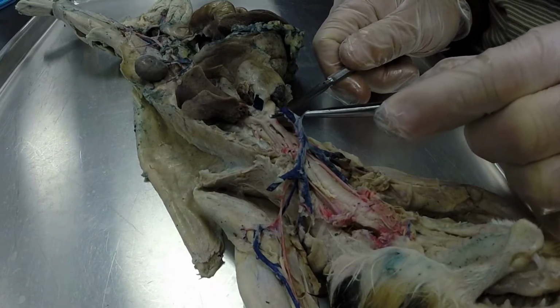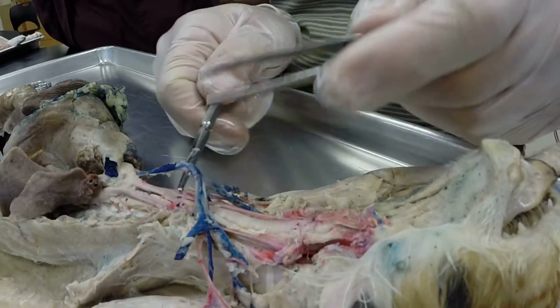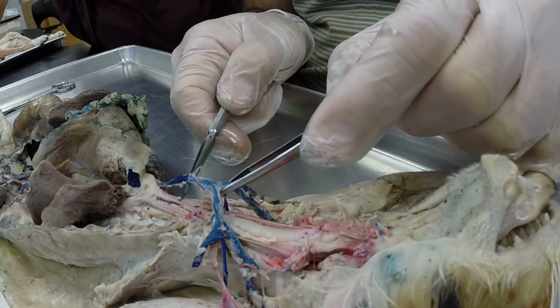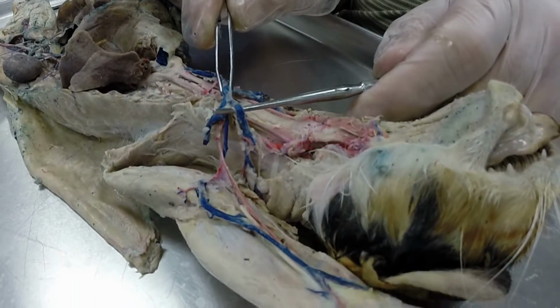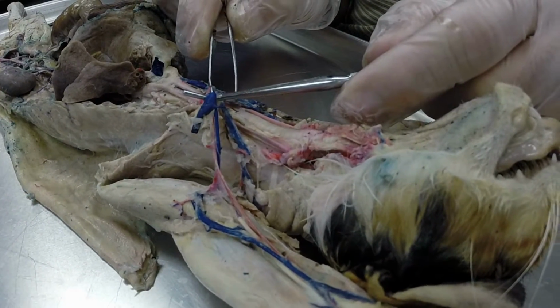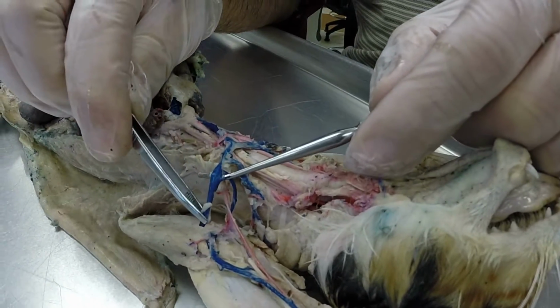And then you have this smaller vessel which is going perpendicular to the pre-cava. This is your internal mammary vein. That supplies blood to the mammary. The pre-cava is going to branch, it's going to fork. The two forks are called the left brachiocephalic vein and right brachiocephalic vein. The brachiocephalic vein is going to branch into this would be a left external jugular vein, and this would be a left subclavian vein. The left subclavian is going to branch into a left subscapular vein and a left axillary vein.